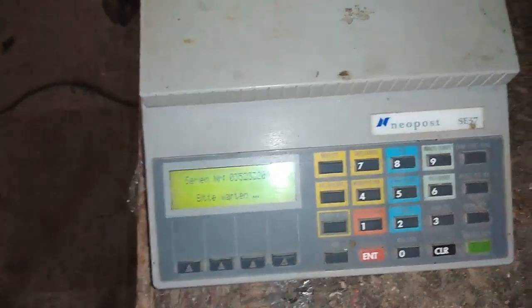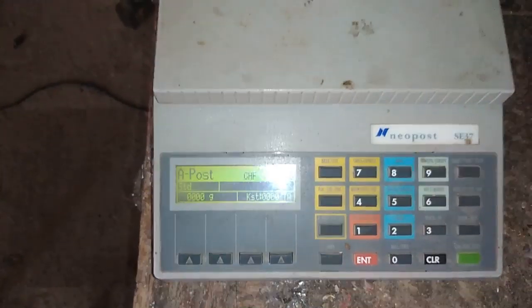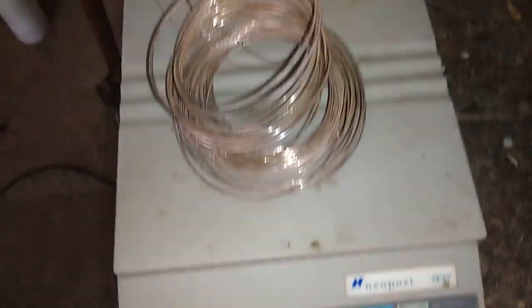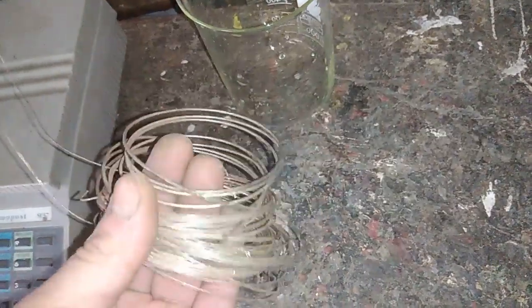I do not bother with the yield and the amount of material and the amount of silver I get at the end, because it's never the same. But here we can do some yield calculation because this is a material that mostly has a similar amount of plating. So: 174 grams of silver plated copper wire. I will add this to the beaker and add some very dilute nitric acid.